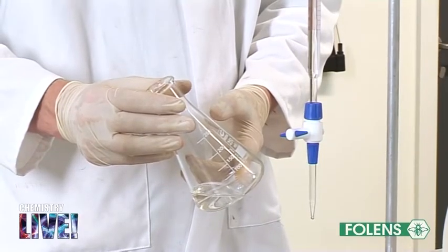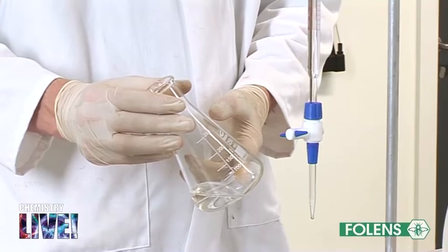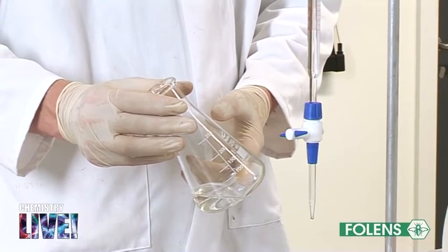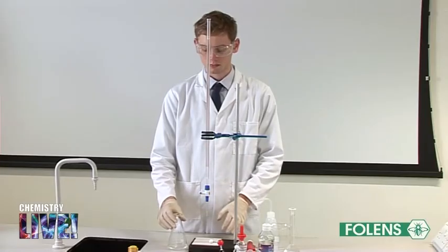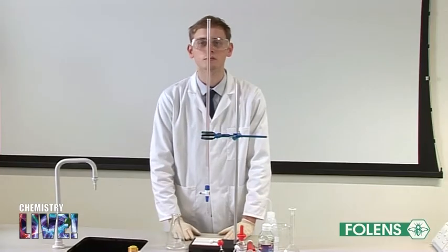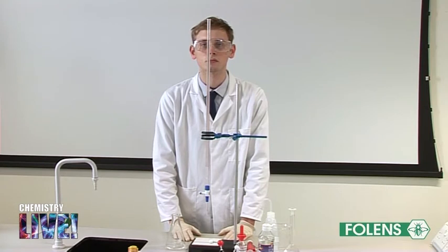The burette has been rinsed out with some of the diluted vinegar using a small funnel. The burette has been filled with the diluted vinegar.